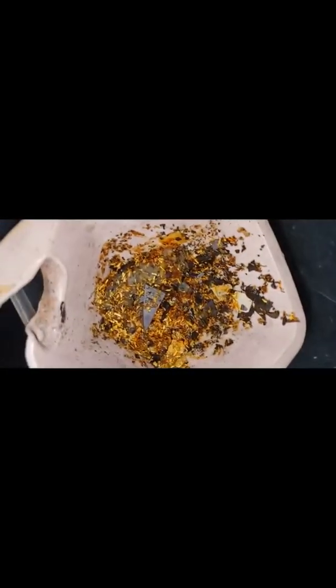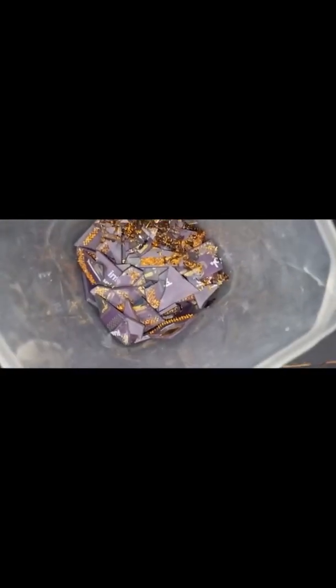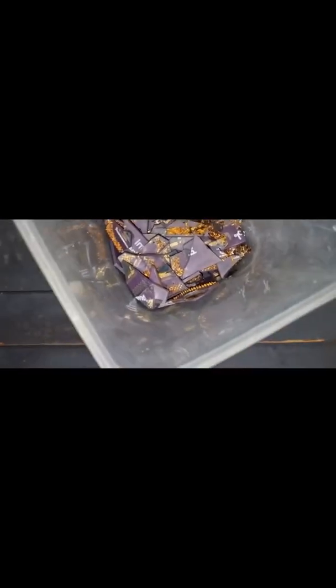Hello, I'm back again. I think I've recorded everything so far. I'm going to stick the flash on — yeah, that's better. As you can see, I'm leaving the ceramics in to refine because there's still gold attached to it. I could have left it more time in copper chloride, but it seems pointless. Plenty of gold there. This was from, I think, 19 Intel Pentiums — you'd have seen that before this part of the video.